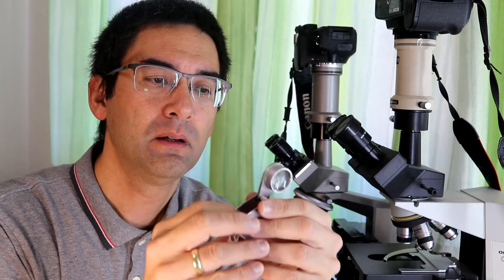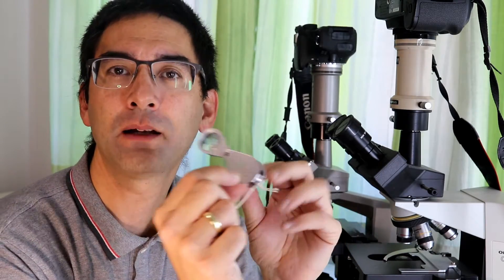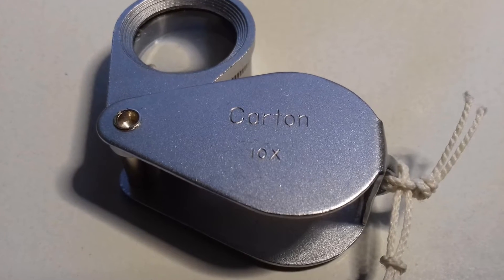So a lens has a focal length — that's the physical property we use to describe lenses — but strictly speaking, magnification itself is not defined as such. You might say that's not correct because these magnifying glasses here have '10x magnification' written on them. The reason is that these magnifying glasses are meant to be placed directly in front of your eye, and when you look at an object there is a point where it appears in focus and is magnified ten times. That only works because we're defining the eye-to-lens distance. Otherwise, magnifying glasses don't have a magnification per se — they only have a focal length.